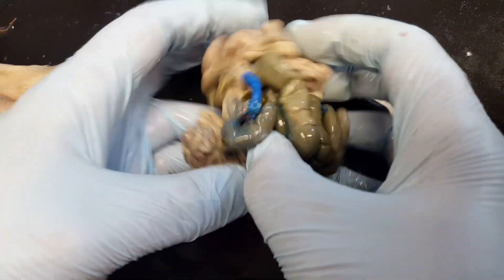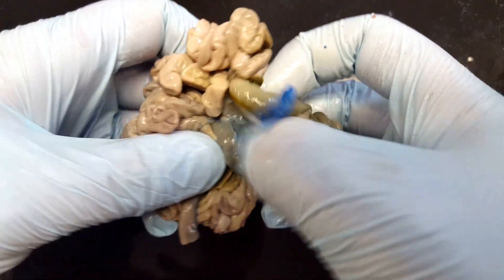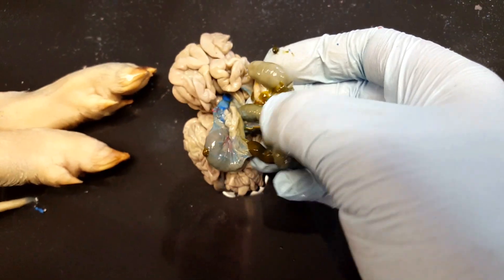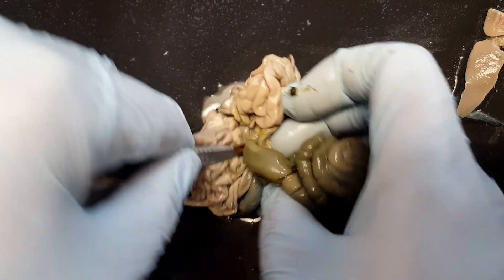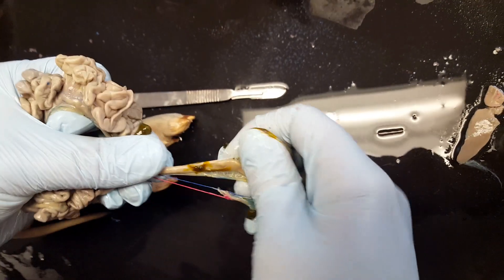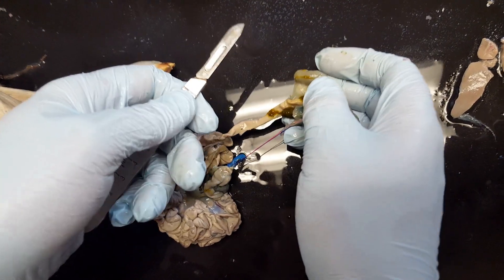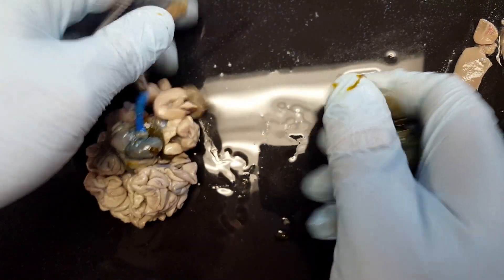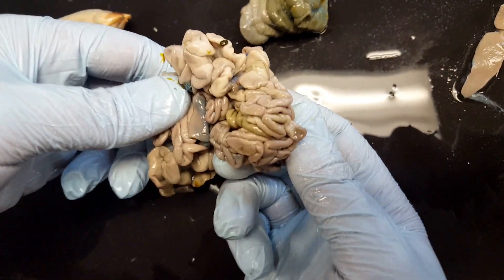Here's small and large intestines, and we can go ahead and separate the two. You can see the end of the small intestine where it's meeting the large intestines, so I'm just going to cut right there. Here's the large intestines including that pouch, and here's our small intestines.